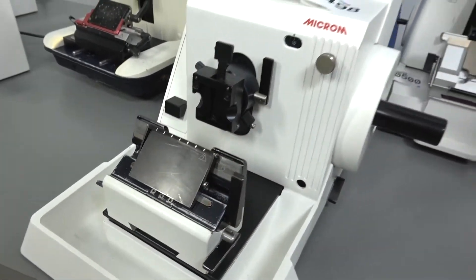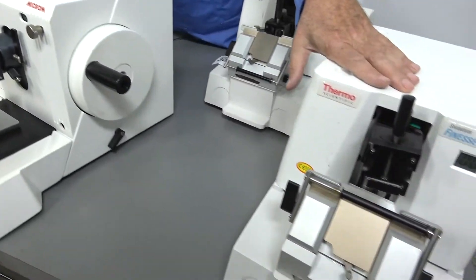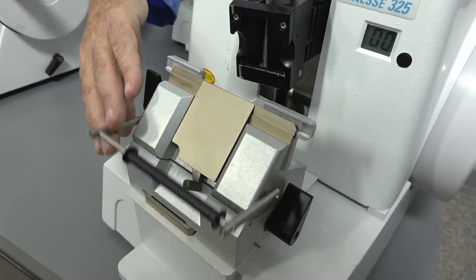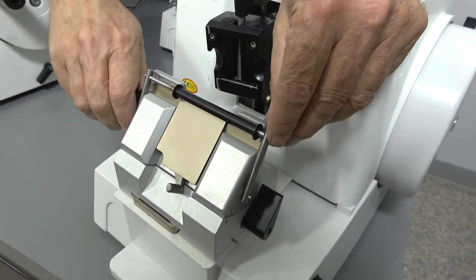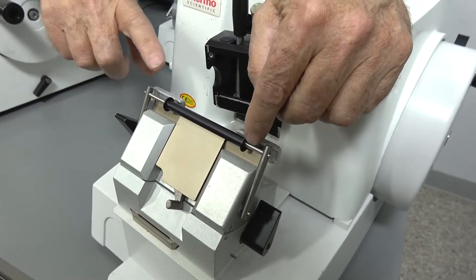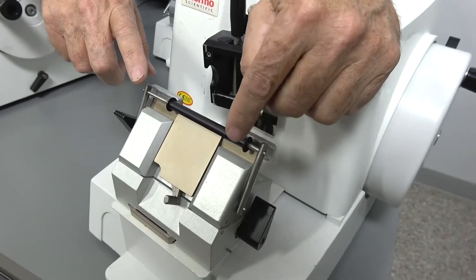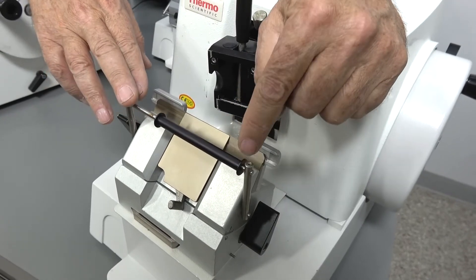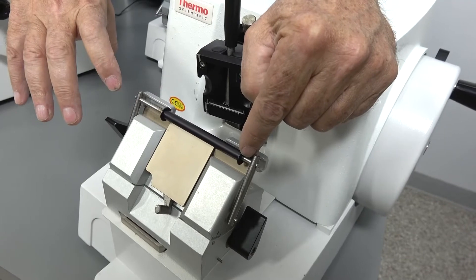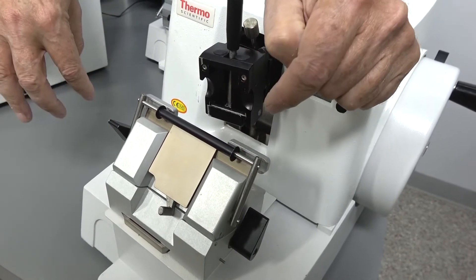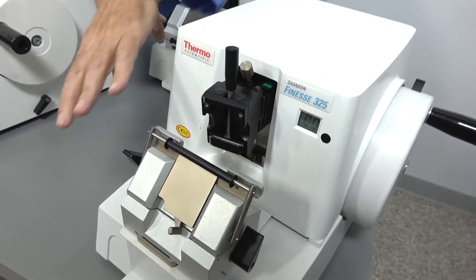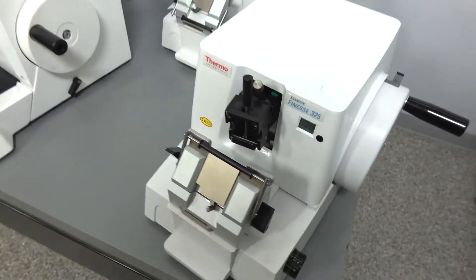Some of the older units, the older designs, you can still move them. This one has a nifty blade guard that's movable. As you push it forward, the rings on your blade guard will encase the blade, and as you push it will move the blade down to another spot. So a very interesting design on that.